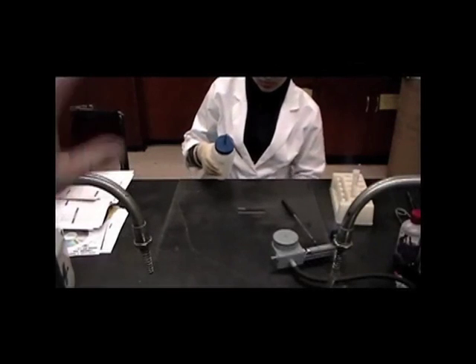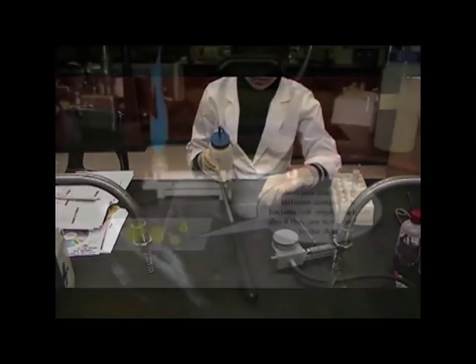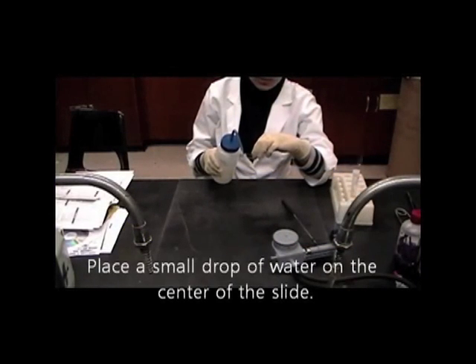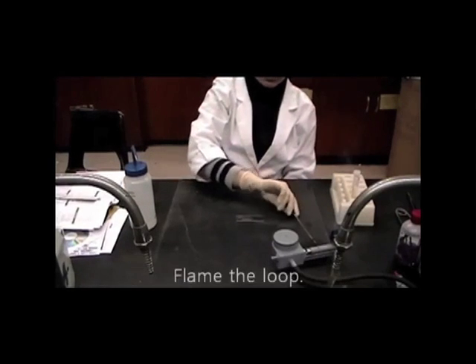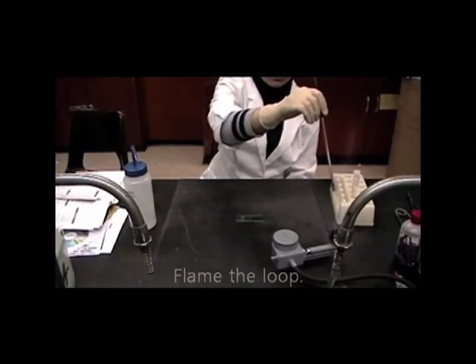The first operation to do before you do the Gram stain is to heat fix bacteria. The first step in heat fixing is placing a small drop of water on the center of the slide. The next step is flaming your loop until it's red hot.